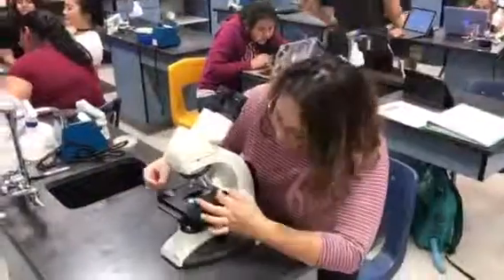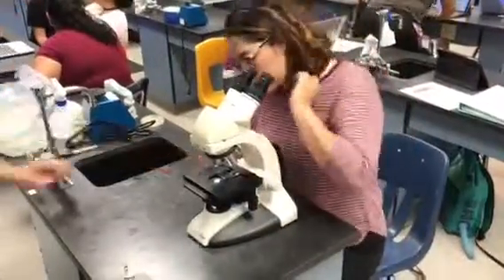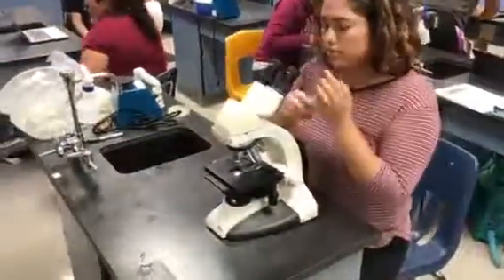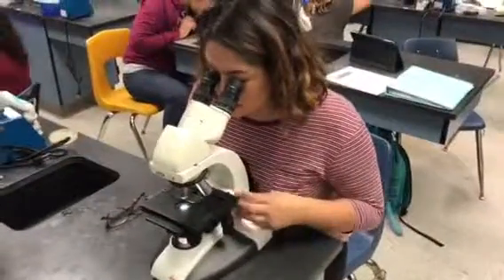Once your slide is all clean, you will be able to put it underneath a microscope and see what you stained. You can get specific instructions on how to use a microscope from your instructor. I hope you guys enjoyed the video and found this helpful — thank you!